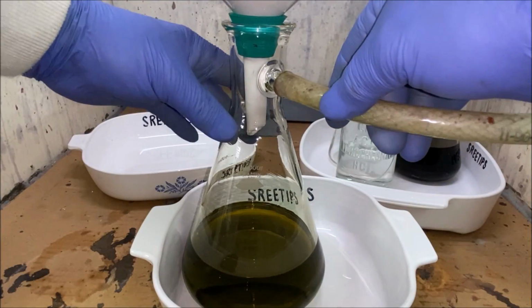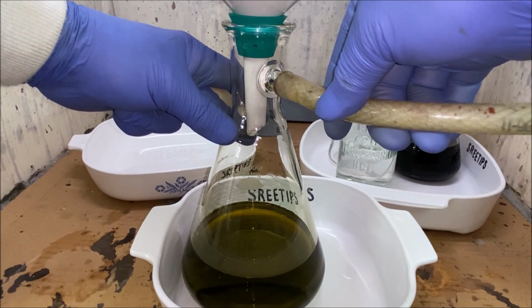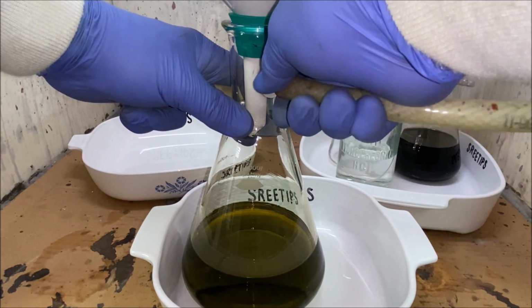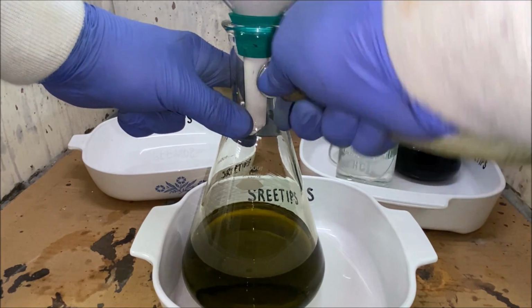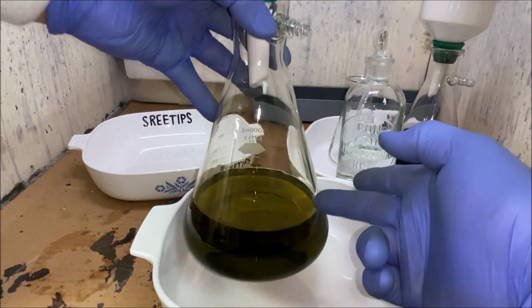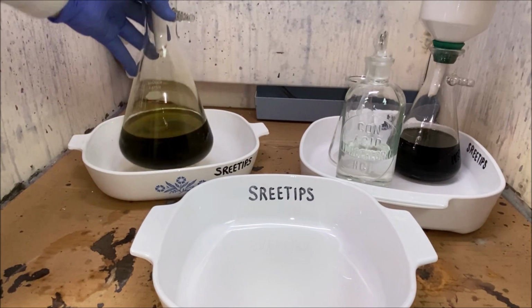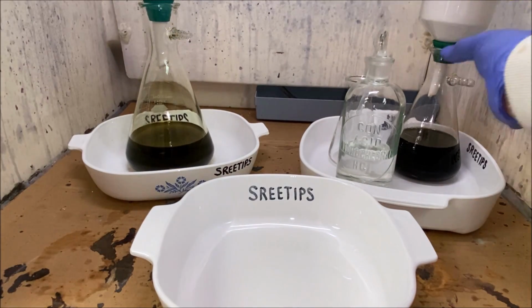This is the solution that we removed all the silver from with dilute nitric boils and collected the black residue in a filter. So now this is going to have gold and platinum group metals in it. So I'm going to set this back out of the way. What we'll do is we're going to pull this one up.